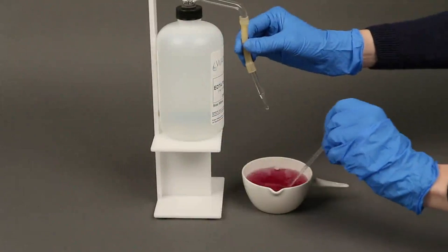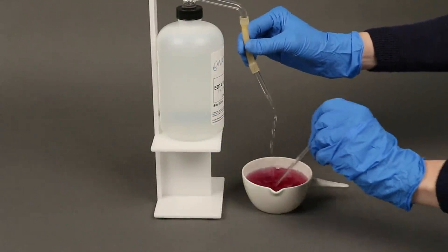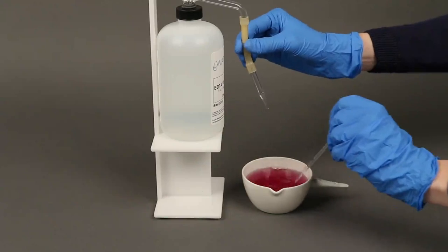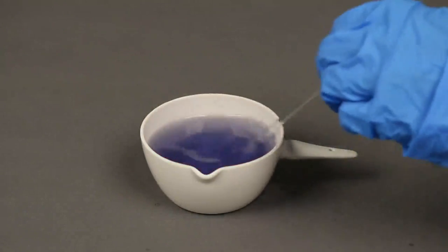Then, while stirring the sample constantly, add the hardness titrating solution slowly from the burette to the casserole dish until the purple or red color changes to blue. This is the end point.